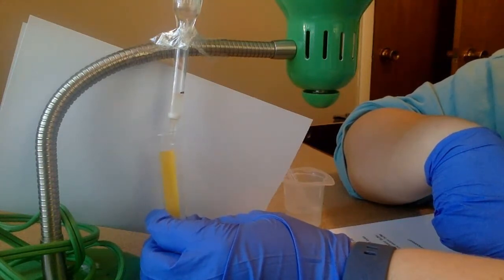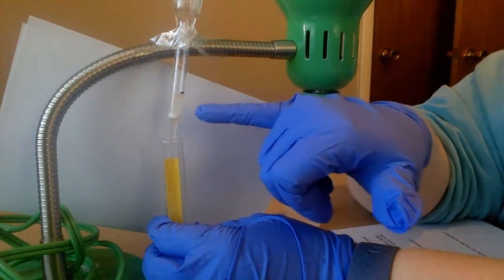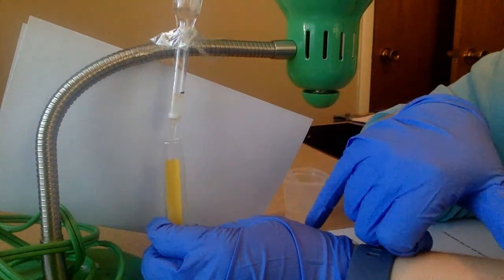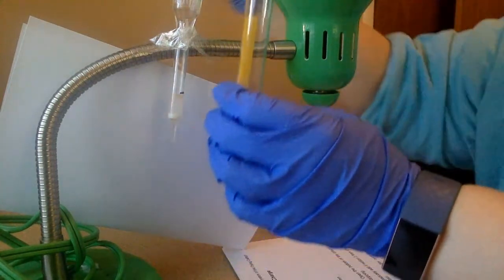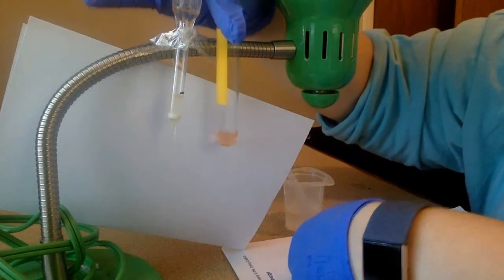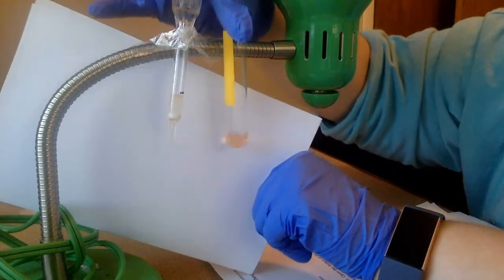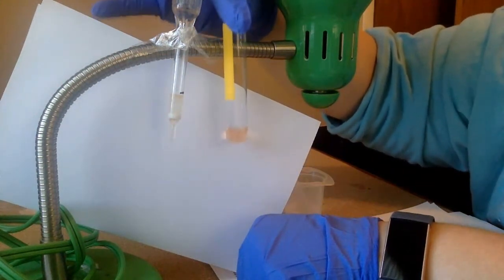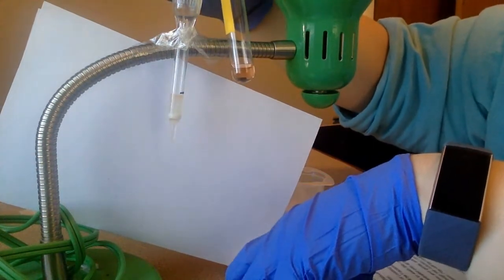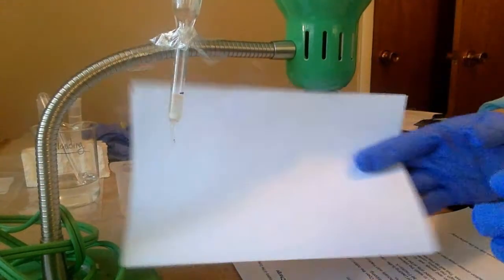And we also confirmed that this is ruffinotoxin because it's stuck to the beads when I washed through an acid. But when I washed through a base, it flowed through, meaning we confirmed its isoelectric point. So here, this is red. It might be light, but again, I did mix it with some liquid here. So this is red, meaning this is ruffinotoxin. Now, I'm going to just set this aside.